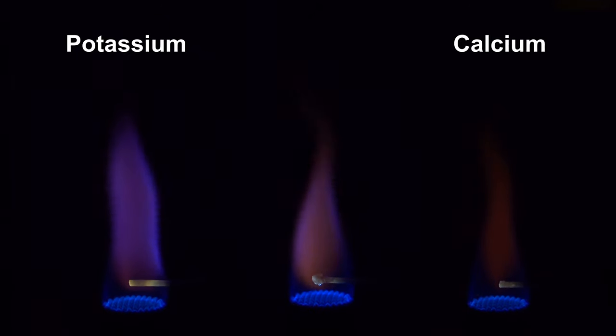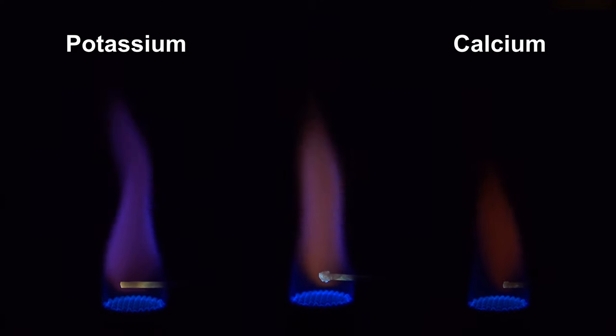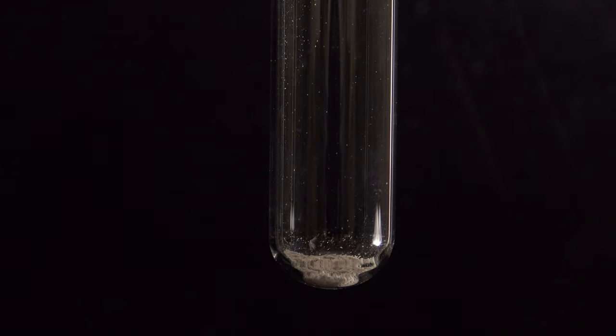With a spectroscope, these could be differentiated easily. In comparison to the alkali metals, calcium can be easily determined from a solution.